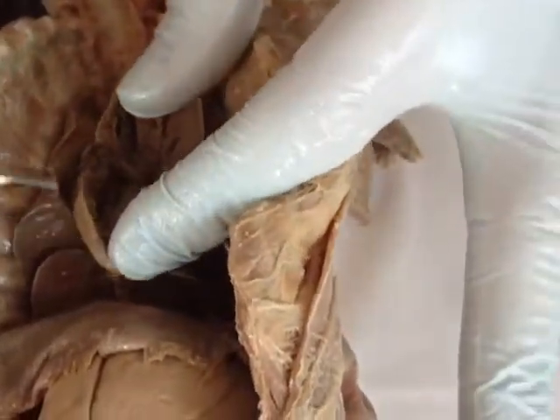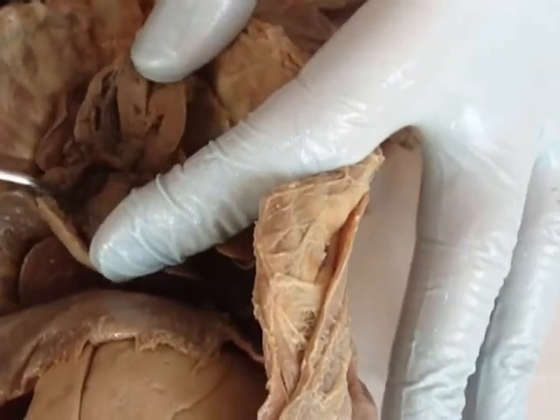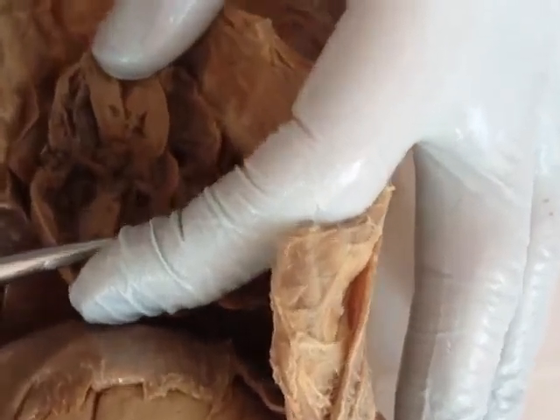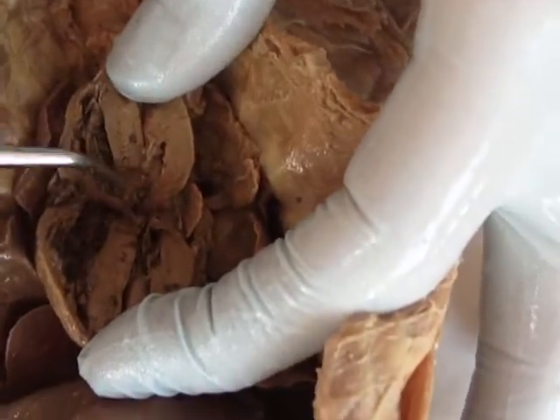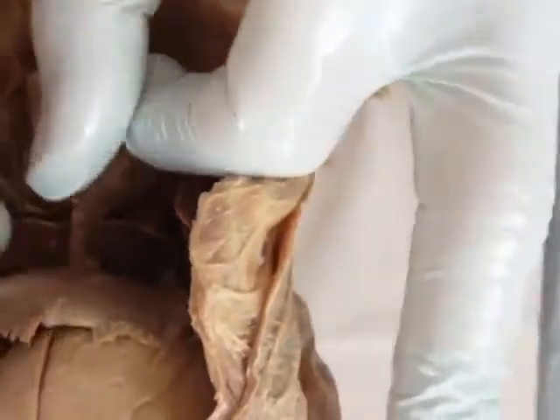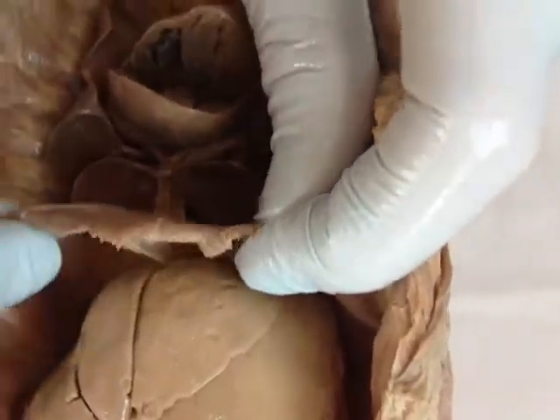On the bottom, the tube leaving the heart is your postcava. When you open up the heart, the thin wall on this side is your right ventricle, the thick wall on this side is your left ventricle, and through the middle is your interventricular septum. Then you have your diaphragm.